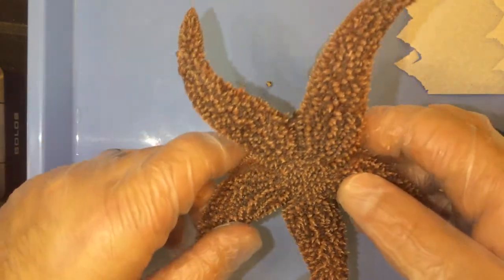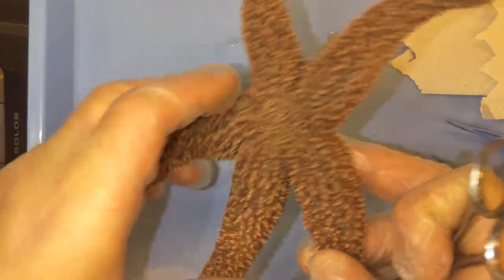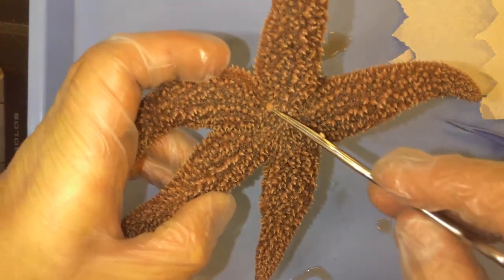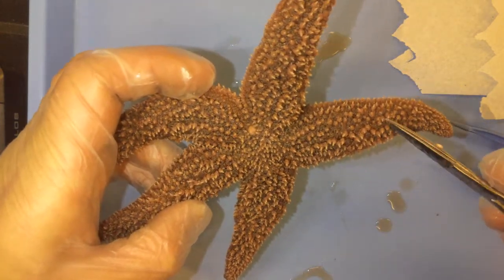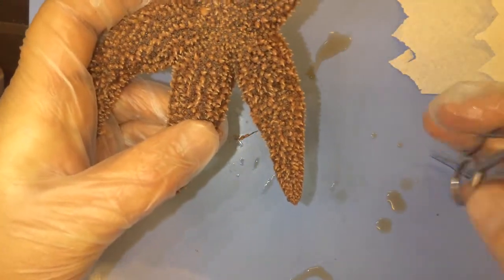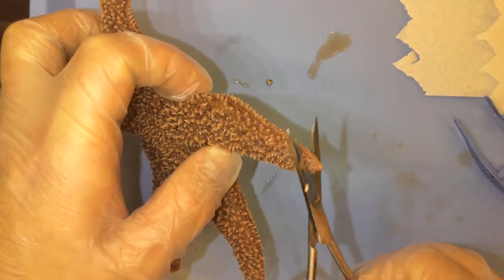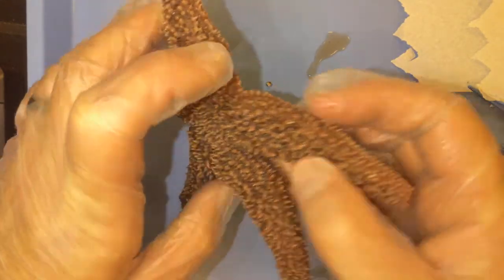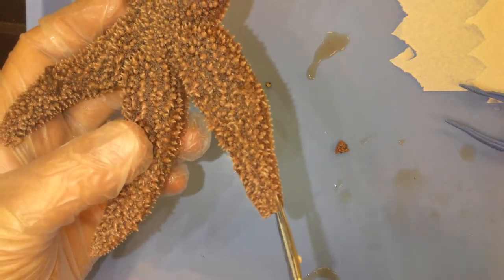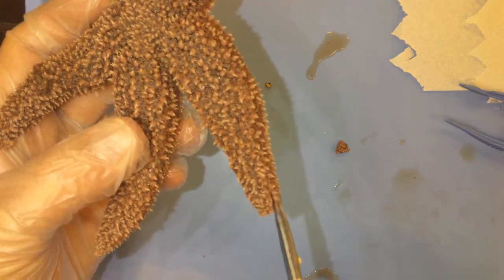Since we just talked about all the basic external structures, I'm going to pick an arm that's furthest away from the madreporite — this is the opening that the water enters into the water vascular system. I'm going to go ahead and choose this arm, make the first cut here, and cut off the tip of this arm. I'm going to stick one blade of my scissors right underneath the opening I made, and I want this to be a very superficial, skin-deep cut, carefully cutting both sides of the arm just towards the central disc.